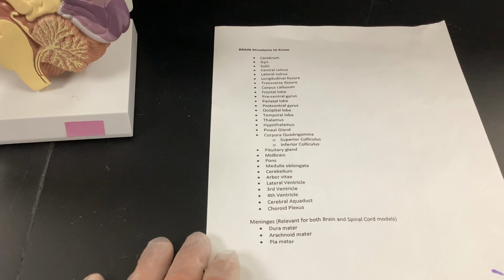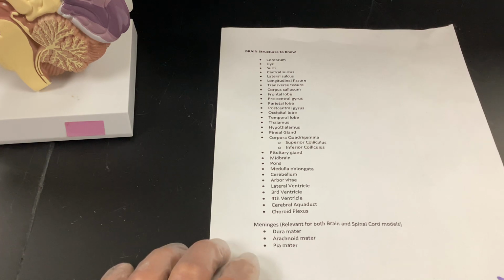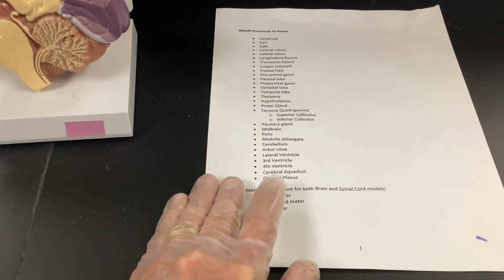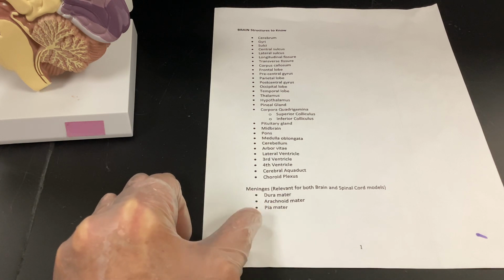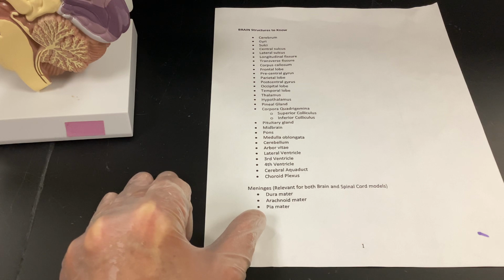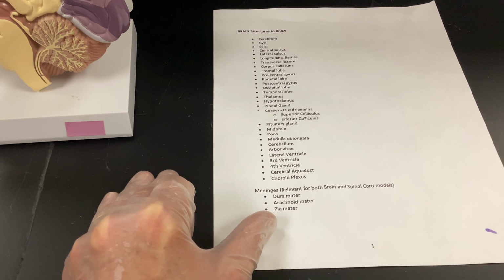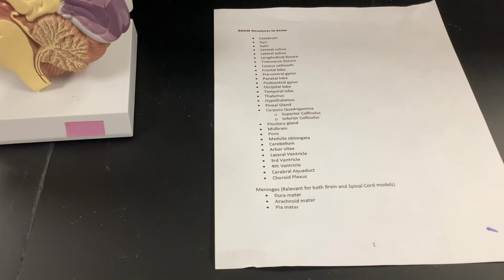And I know we went over all of these in lab. I was walking around and asking you guys all these questions. So I'm going to grab the brain with the dura mater on it, so we'll start down here, okay? I'll go into dura mater, arachnoid mater, pia mater, and that is from superficial to deep. Remember the dura mater means tough mother. And I'll show you, I literally pick up the brain with the dura mater. You can see how durable it is.